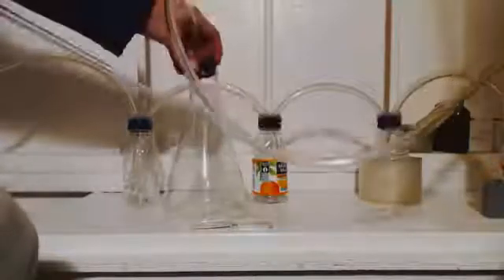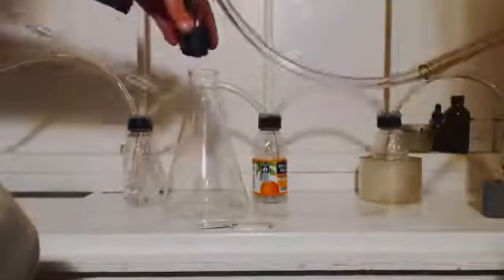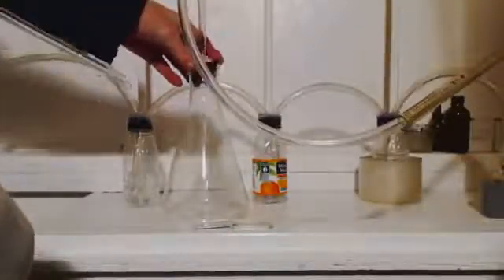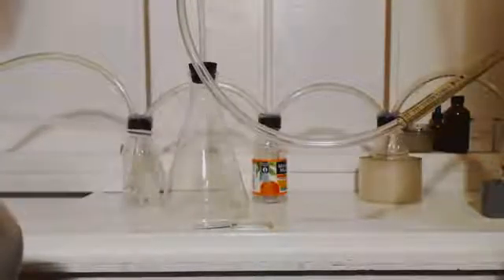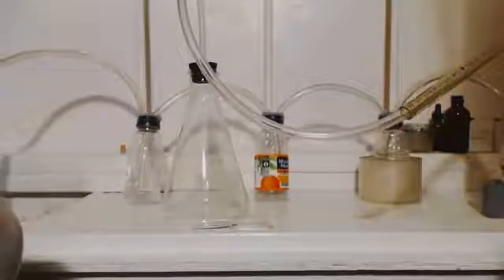You can see it comes - I got a rubber stopper. Rubber stopper comes out, goes down through my bubbler. You saw my other video where I made a bubbler, you'll know what it is. I have sodium hydroxide in two of them. Two of them are empty to prevent suck back.